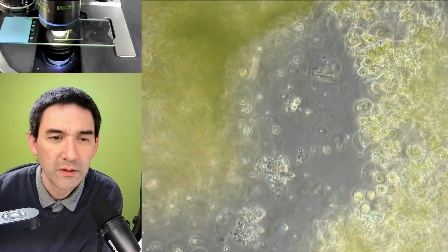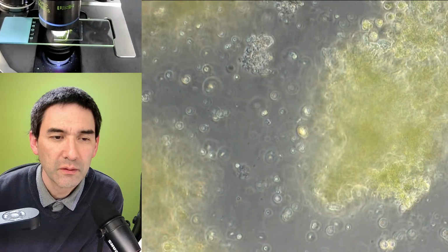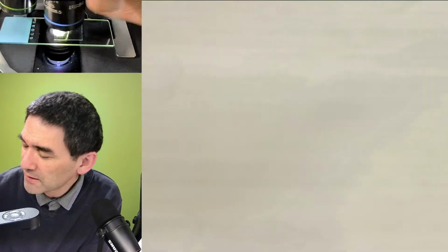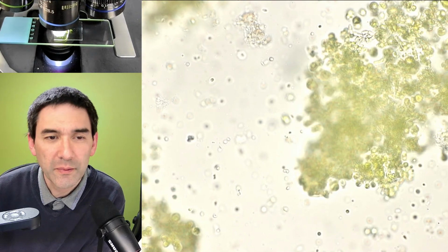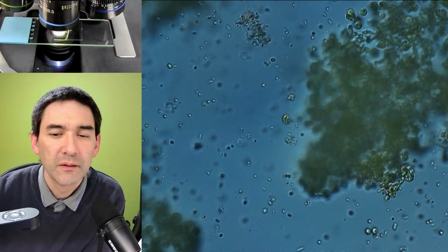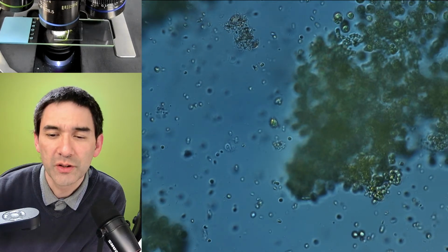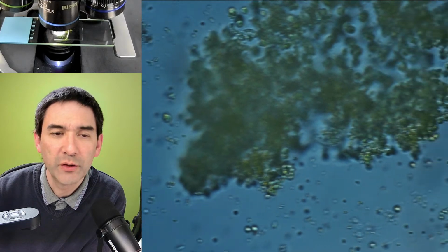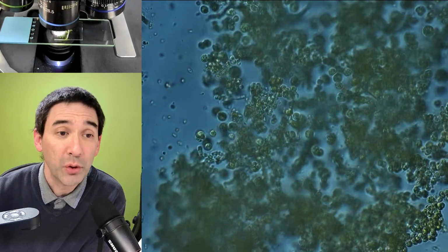Okay. I was actually hoping for a little bit more. But you know, that's the whole idea of microscopy. You don't always know what to expect. And maybe it's just a question of being patient, yeah? It looks like a single species of algae made its way into the bottle. That's quite well possible.